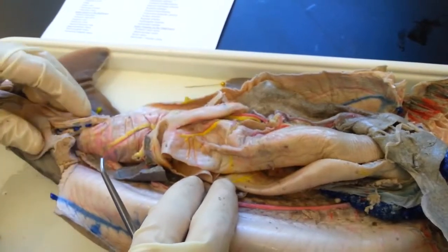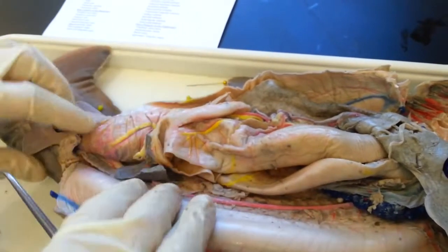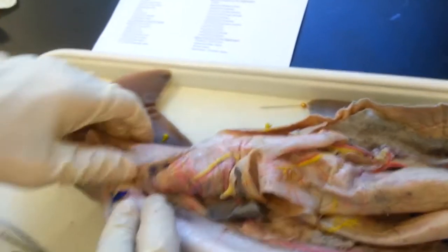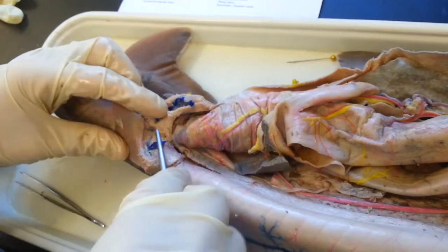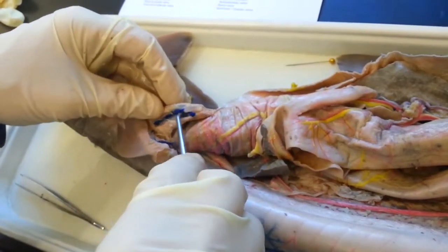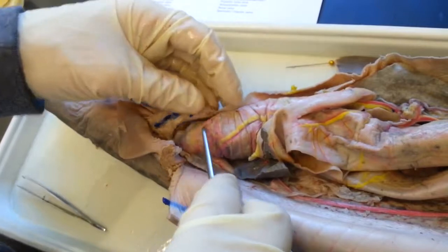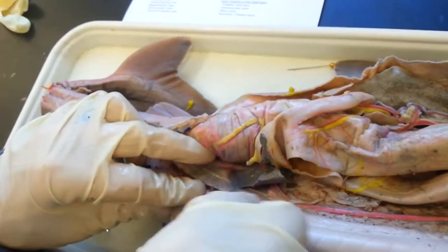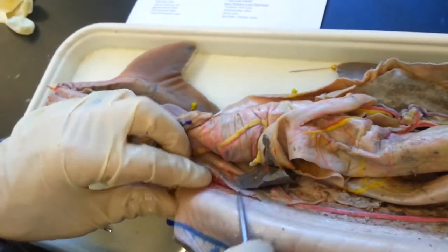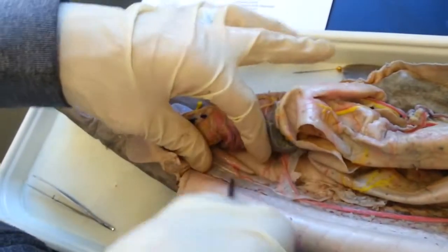The renal portal system — for some reason the latex didn't get injected very well. What you have is the caudal vein in the tail, and that splits into the renal portal veins, which then go into the kidneys. You can't see them because they didn't get latex.